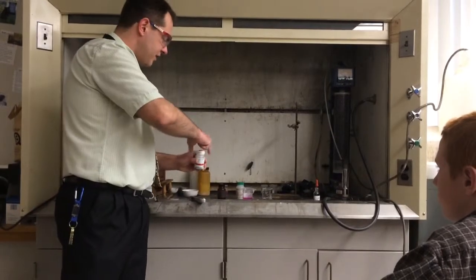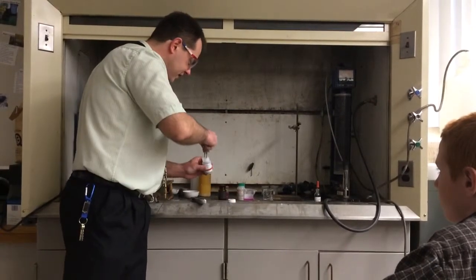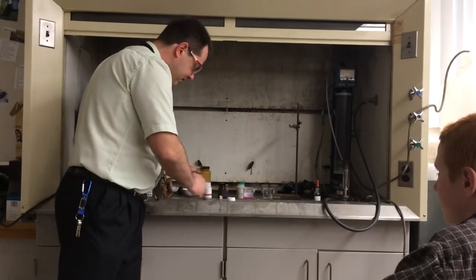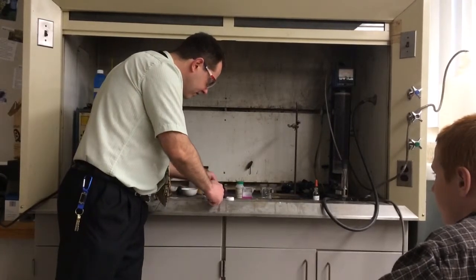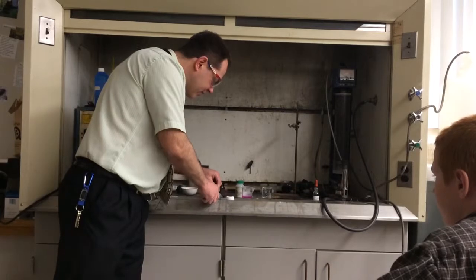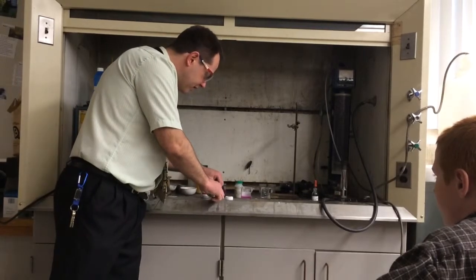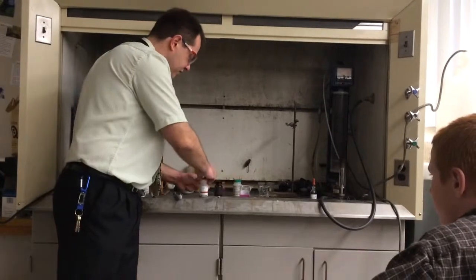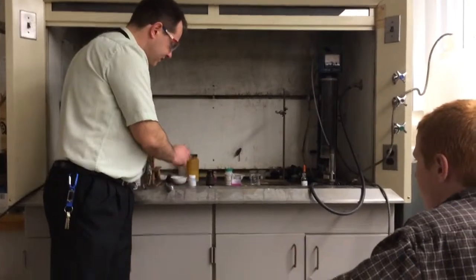Okay, so real quick, the next one is potassium metal, so we would expect potassium to be slightly more reactive than... I think that one would be very bad. That would be very bad. This is even softer, by the way, just so you know. I know you don't have the experience of cutting this, but... Can we touch it? No.